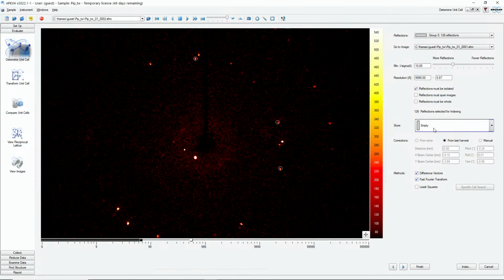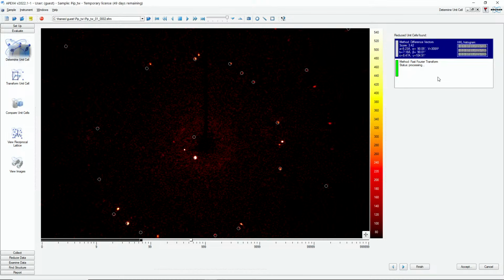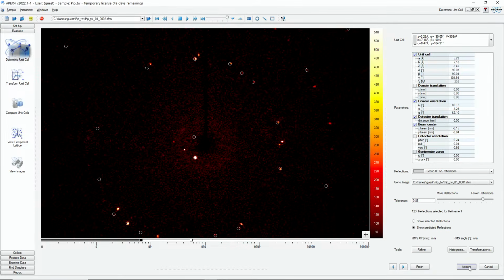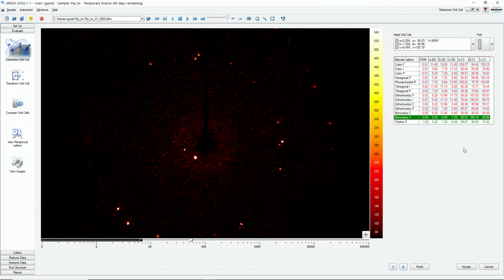A matrix describes the relationship between the crystal system and the goniometer system, and it includes the unit cell information. So we index this, and we have a pretty good fit. Wow, that was pretty quick. Yeah, we have two different methods that give us the same information. So we accept that. We'll refine this, and talk about this later a little bit. We can also do a Bravais check, and it wants to be monoclinic, so it has a little bit of symmetry.